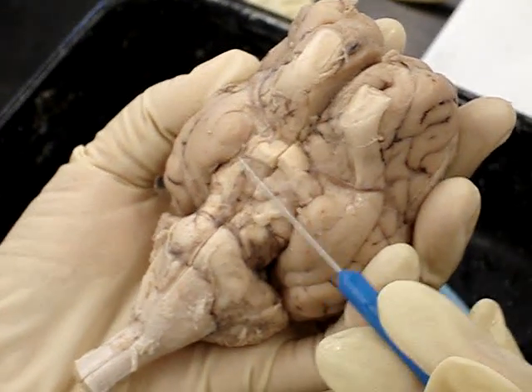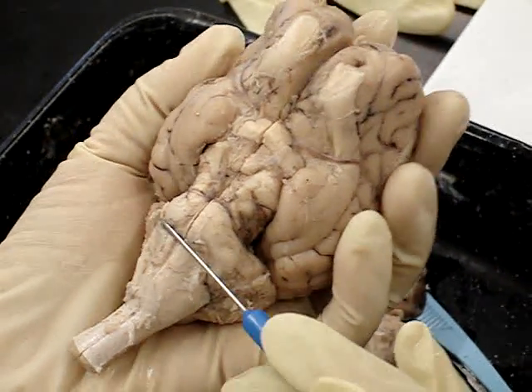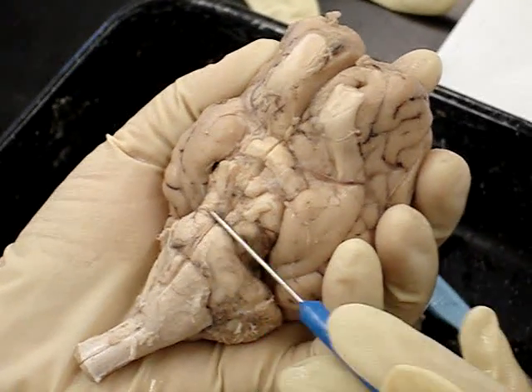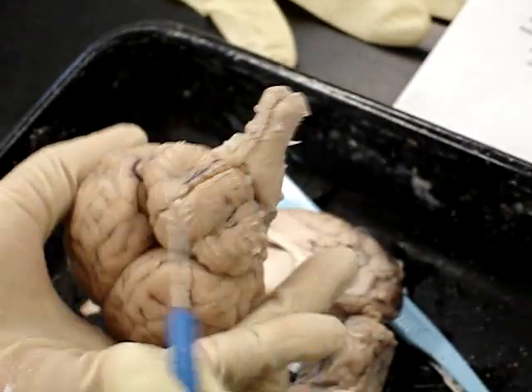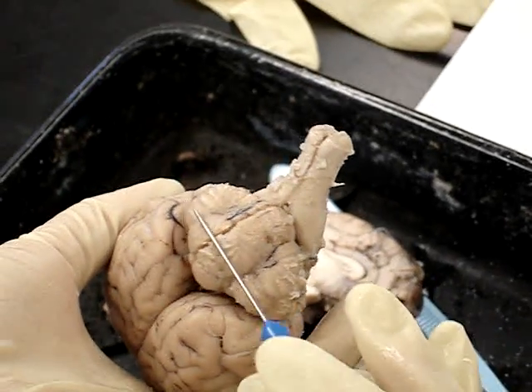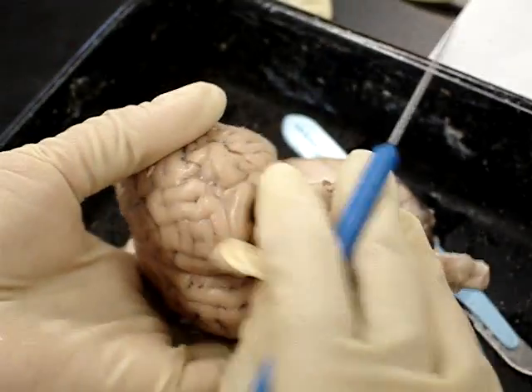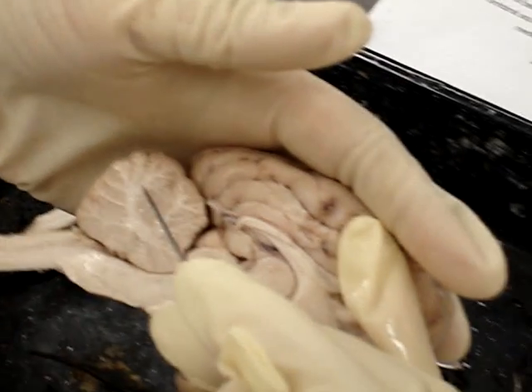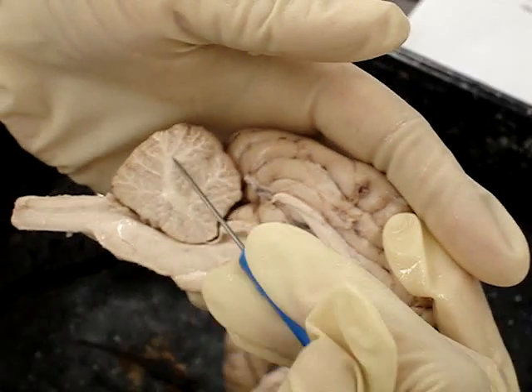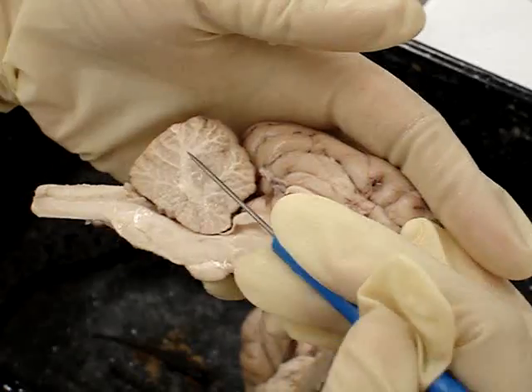This is the brain stem from here down. The pons are these big bumps on the brain stem. The cerebellum is this portion — it's called 'little brain,' so it's the smaller part. The arbor vitae is this white matter that looks like a tree, like tree branches. That's the arbor vitae, tree of life.